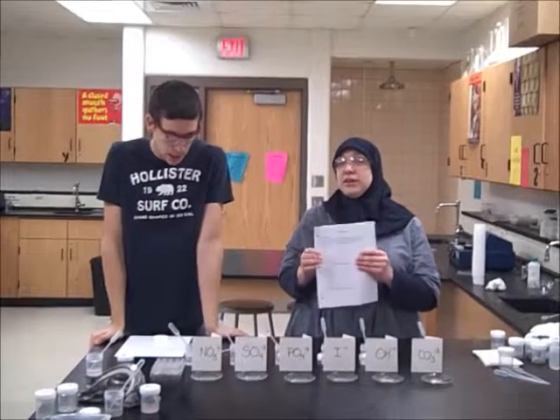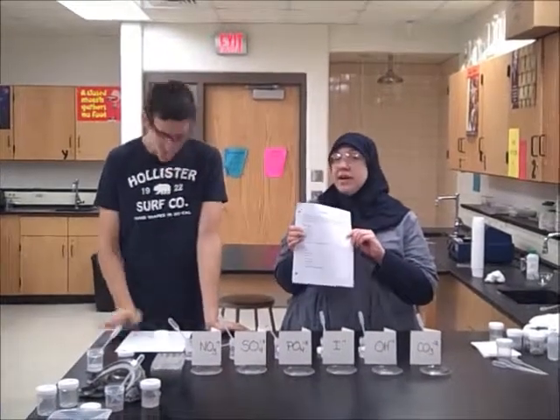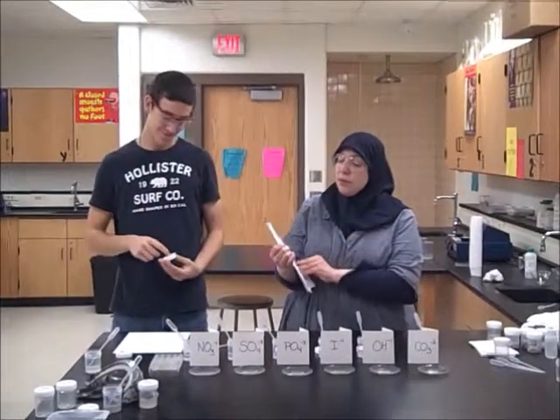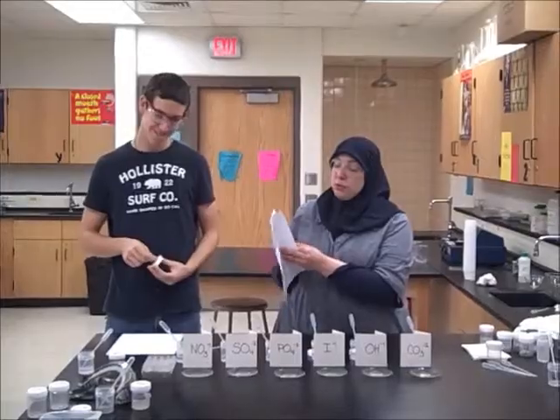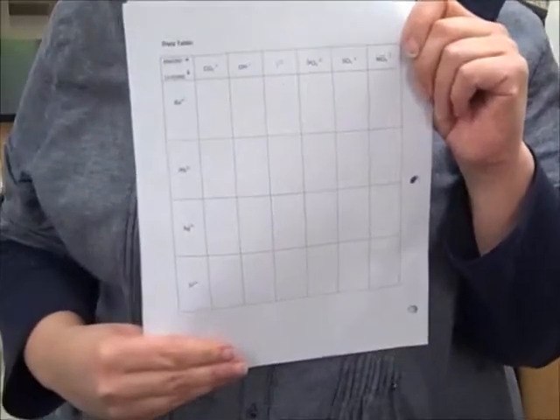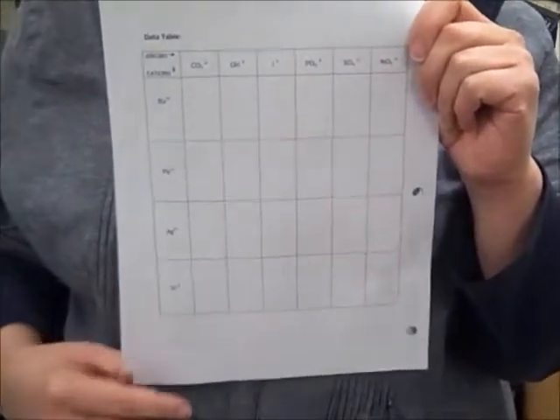All right, so we are coming here with our next lab, the Ionic Compounds lab. This is the lab right up for Goal 4. We're going to go straight to the point and get to your data page, your first data table, where you're going to be writing your observations of what you see.